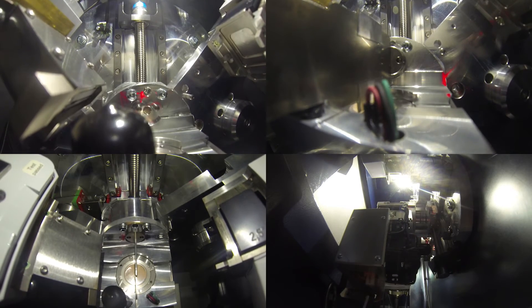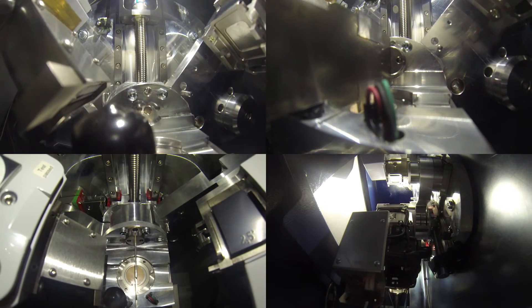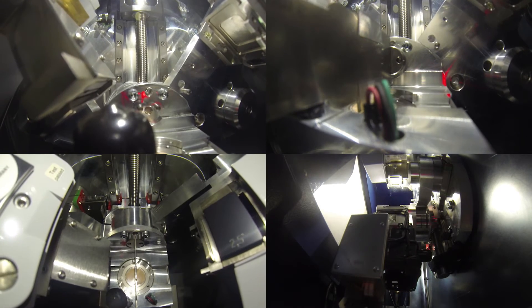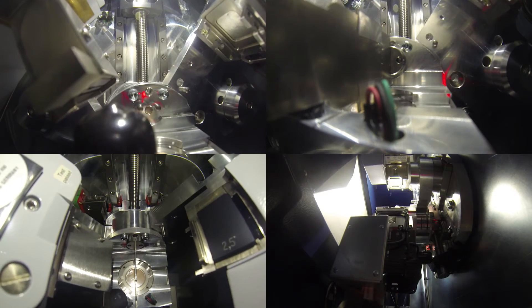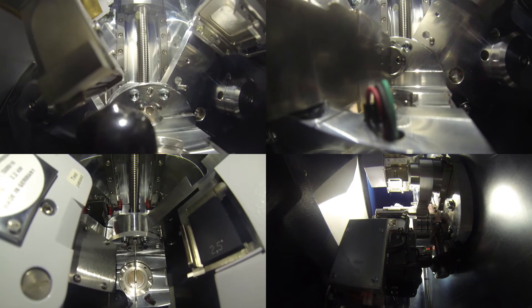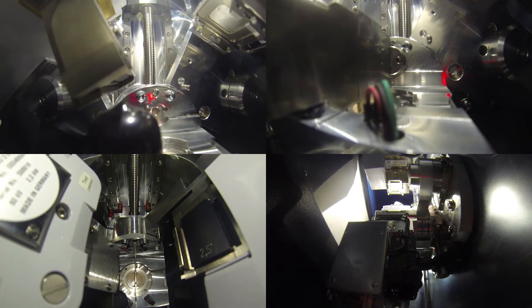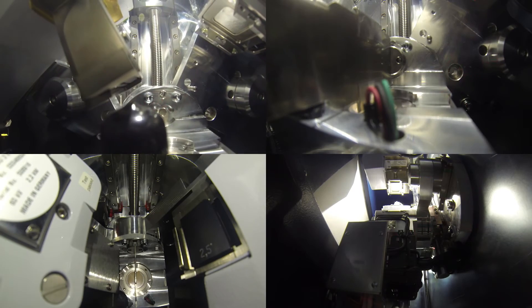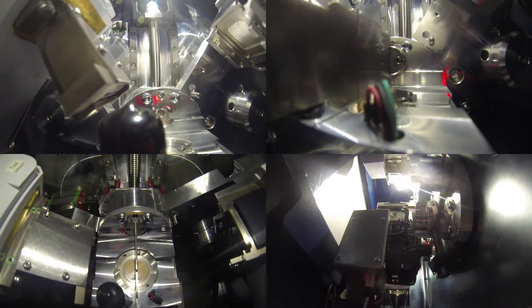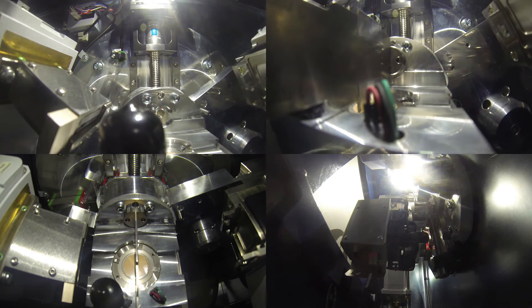On the bottom left corner, you can also see this metal slit. This is called an air scattering slit, and this reduces the amount of background noise that occurs because x-rays can also scatter off of air as well as other samples. Now the scan's finished, and it's going to reset to its home position so you can unload samples. And that's it.